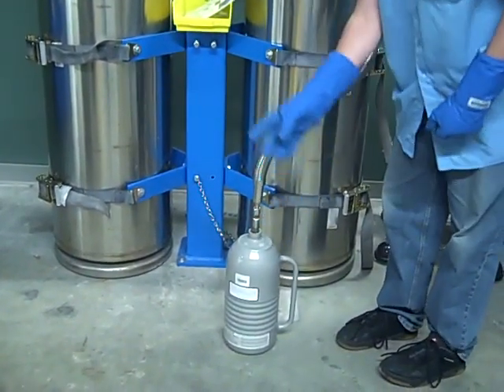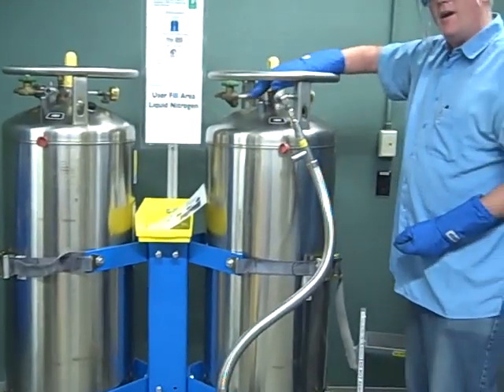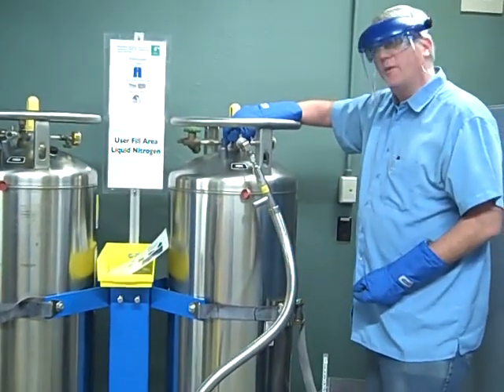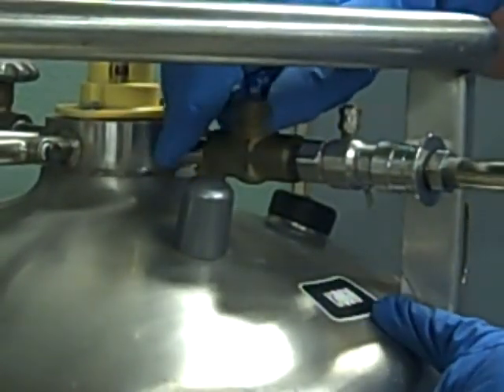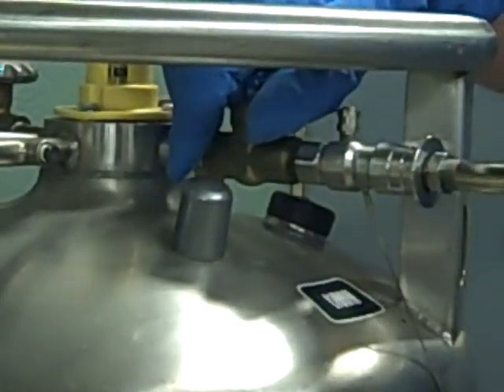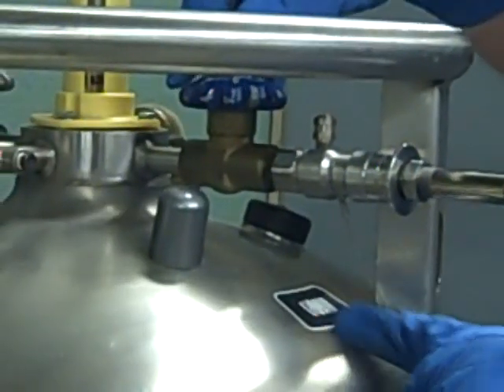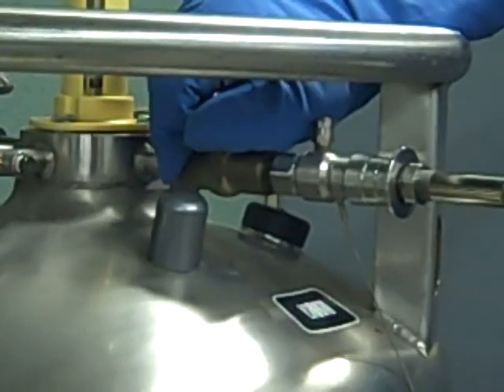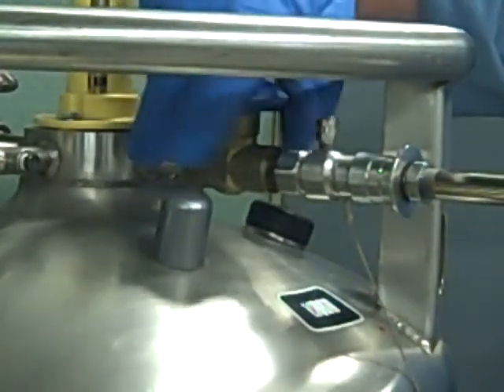The transfer line has a little catch here to make sure that it doesn't go all the way sealed in. Now I'm going to reach up to the knob here — this is where I will turn on the liquid nitrogen flow. The liquid flow side is what you want; you can see this one is labeled liquid. You just turn on this valve — it can be a little harder to turn at first.